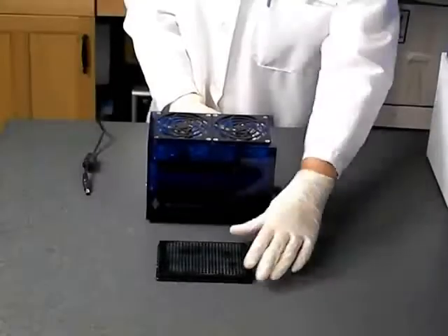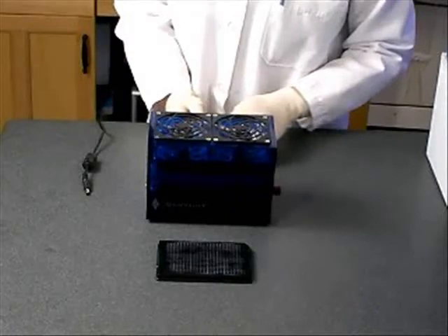After applying your samples, it is necessary to dry the GenPlate. You may do this by placing the unsealed plate in a biosafety hood or other clean environment with less than 40% humidity overnight, 12 to 16 hours in most cases. If the humidity is higher than 40%, it may require up to 48 hours or longer to adequately dry the GenPlate. Please ensure that the elements are completely dry prior to sealing.